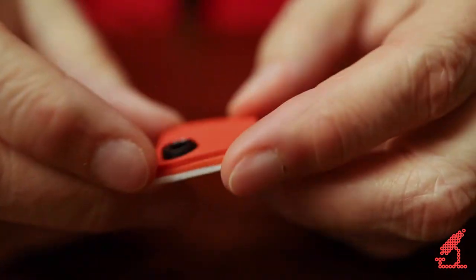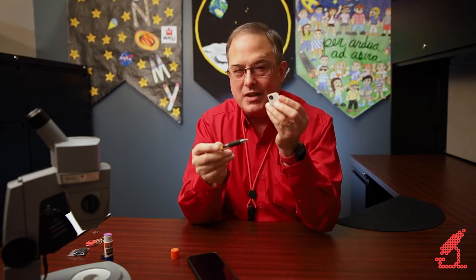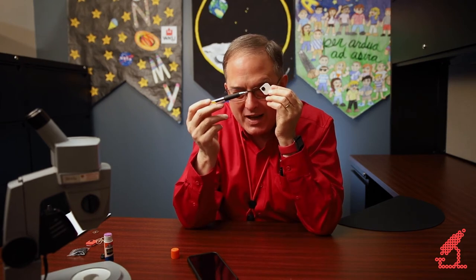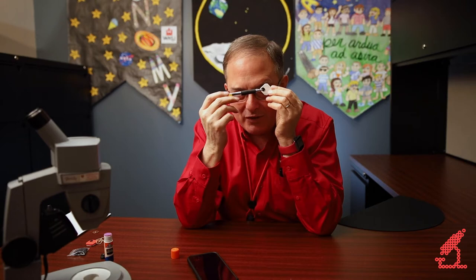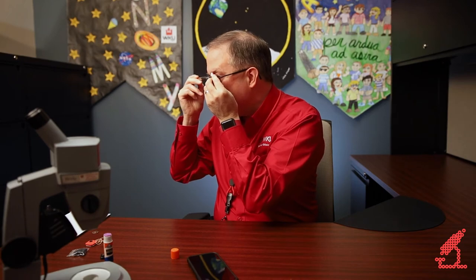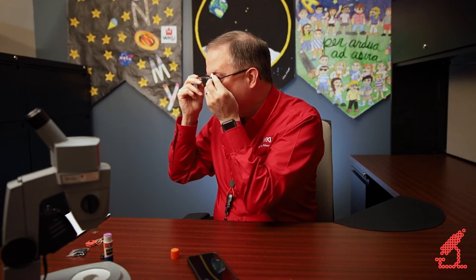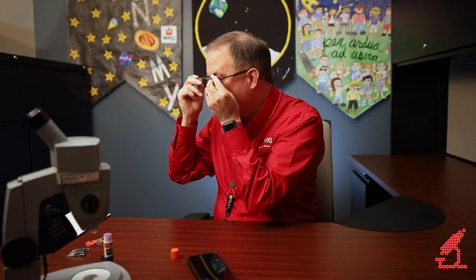This microscope is cheap enough and built quickly enough that students can simply take them with them — it's almost a consumable item. Now using it is very easy. There are two ways: you can use it with a cell phone, or you can actually use it by yourself. Let's say I want to take a look at the ball in a ballpoint pen. I take the lens, bring it close to my eye, and then bring the pen close to the lens from the other side. Right there it is — I've got a beautiful magnified view of the ball in a ballpoint pen.